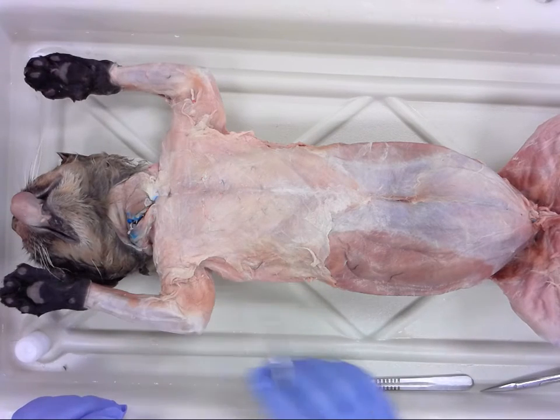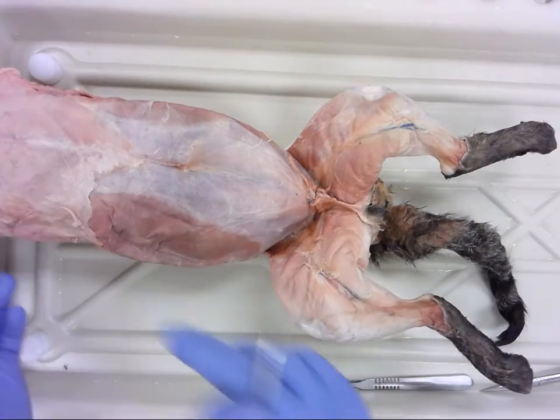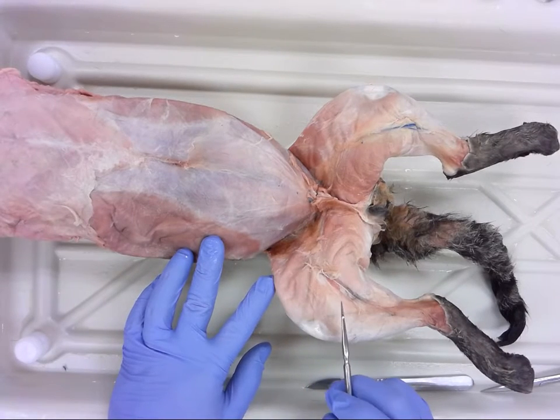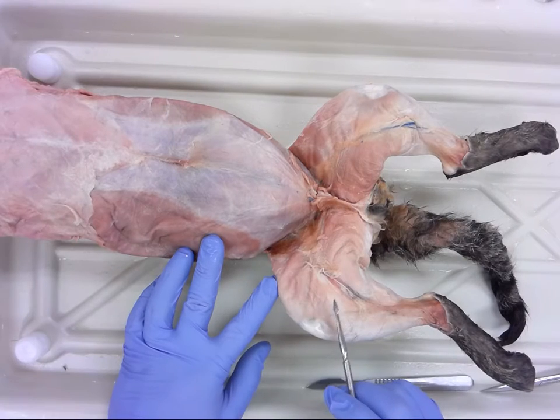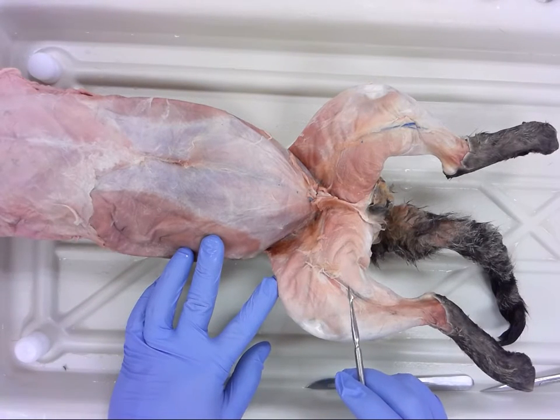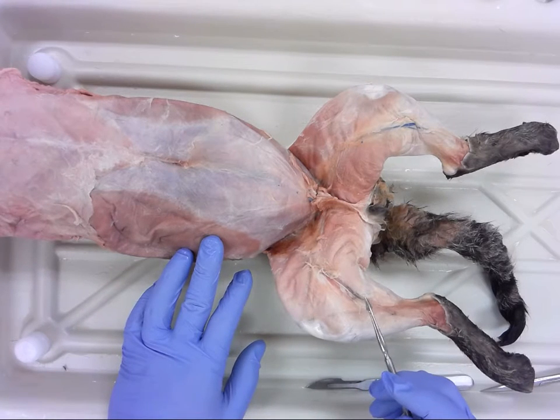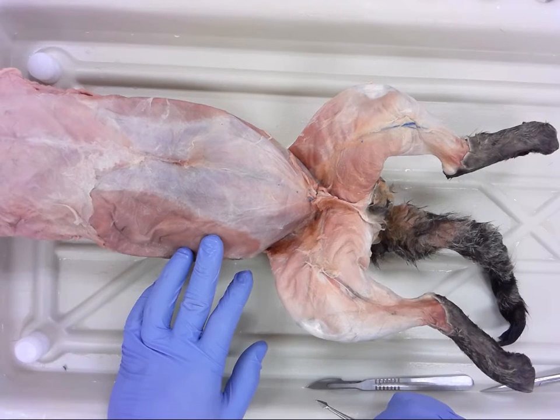Once we get through those, we will then move down to the lower limb. Just shift here real quick. And we'll get into the hind limb. You'll see some superficial muscles, sartorius, gracilis. Then we'll get into our quadricep group and our hamstring group, and you will be responsible for the individual muscles in those.